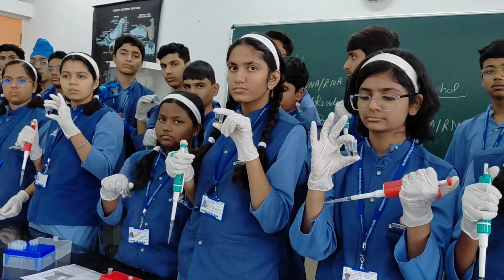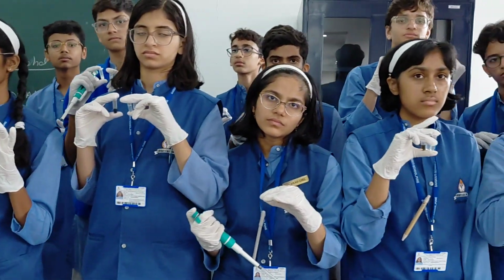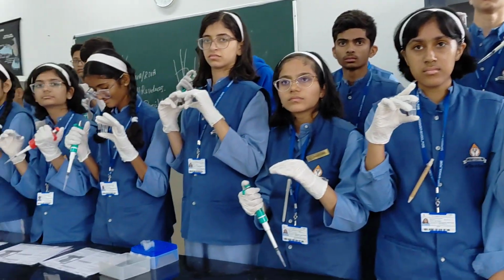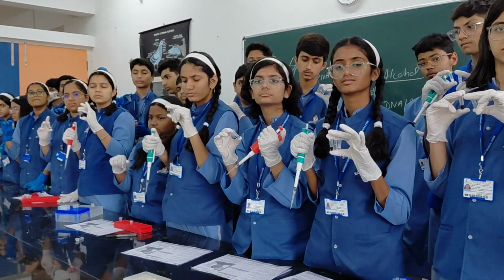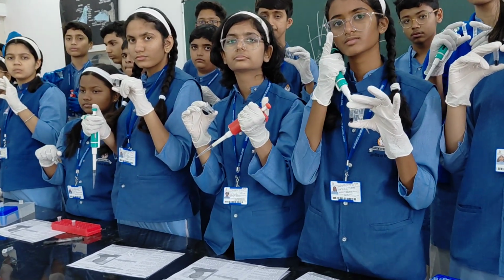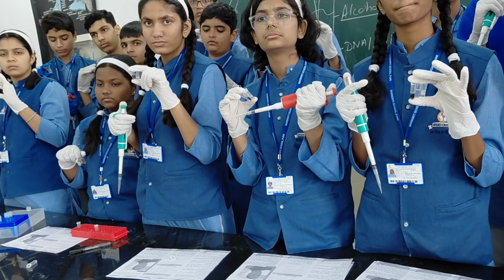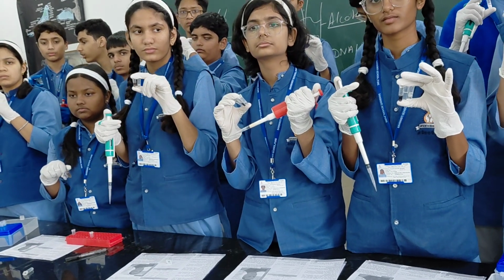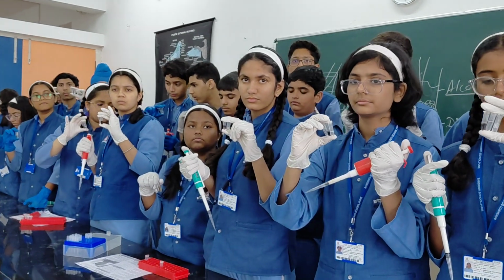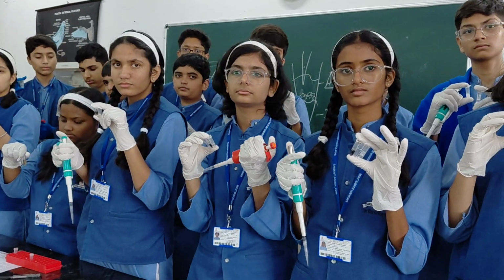Then you go for the DNA washing. If the DNA is coming from solution or salts, there is definitely some salt over it, right? To remove it, once again you add alcohol, mix, centrifuge, discard the liquid, and at the bottom save the DNA. That will give you quality washed DNA. Once it is done, let it dry overnight or a minimum of 2 to 3 hours. All the alcohol from your tube evaporates and you will see only dry pellets of DNA left. You just add water or DNA storage buffer solution and put it into the freezer. That is your final step.